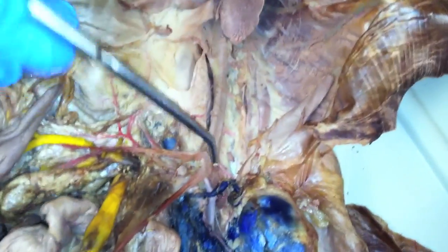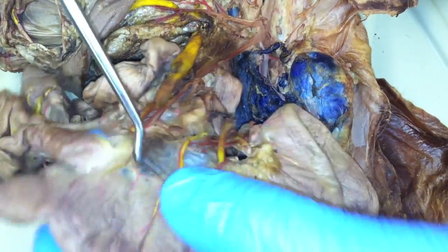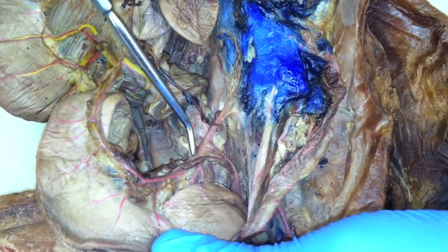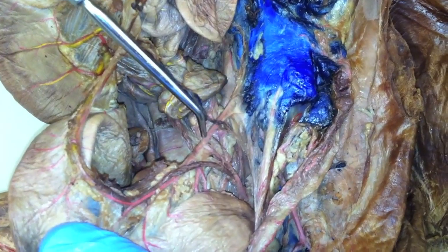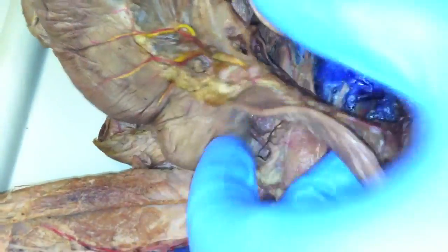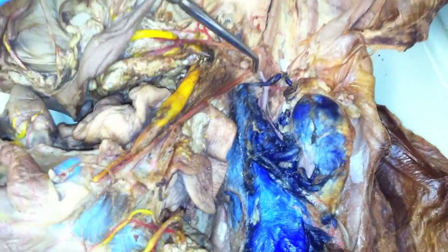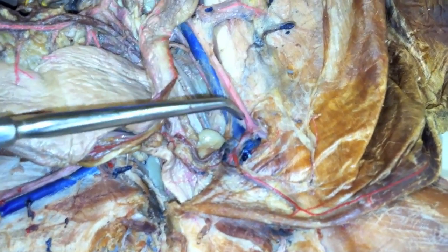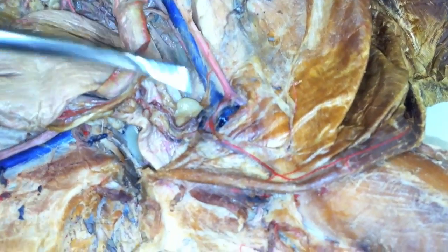A correction: coming down from the abdominal aorta, when it branches into the cranial mesenteric, it does not branch into the left colic. It branches into the middle colic, which runs along the intestine, until it branches into the left colic off of the caudal mesenteric. So here's caudal mesenteric, cranial hemorrhoidal, and it comes up into the left colic. Middle colic continues to run along all the way up and continues into the cranial mesenteric. External iliac, femoral, deep femoral, and caudal epigastric artery. Deep femoral is short, and the rest is the caudal epigastric.